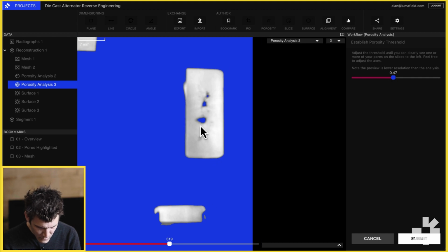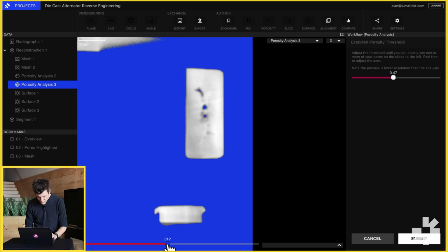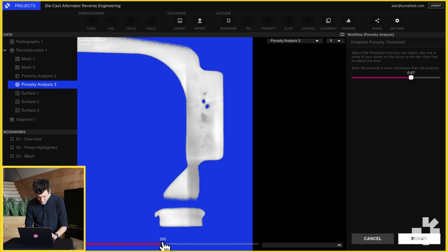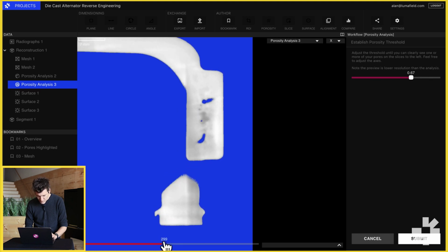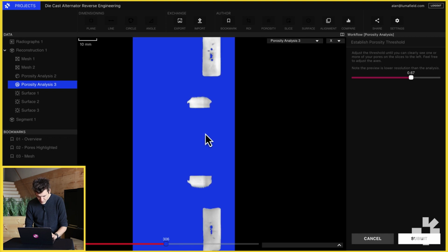capturing these big pores. We can move this around and slide it through to see that we've got a pore here that we're not catching. So I'm going to move that threshold up a little bit more. Let's see that we're now catching that pore. We've got a little bit of microporosity here that's still a little bit too low density to capture. So I'm just going to bring this up just a little bit. So now you can see that we're getting really good coverage of that porosity network here in the casting.